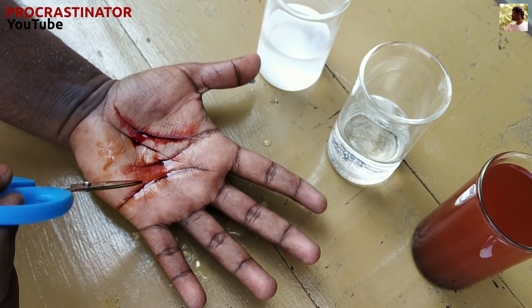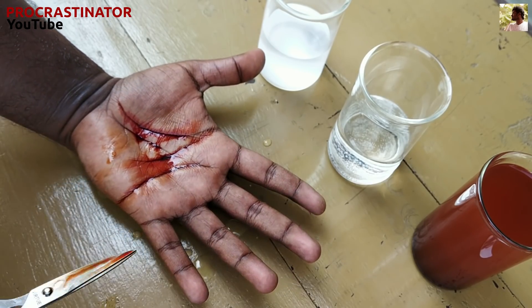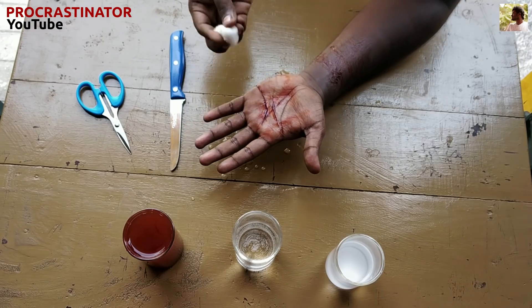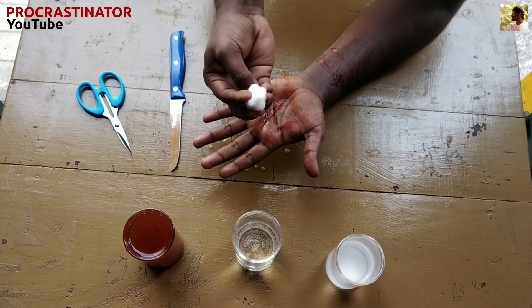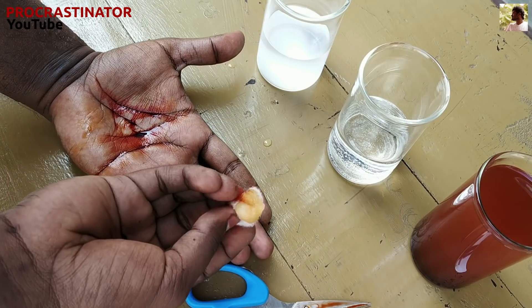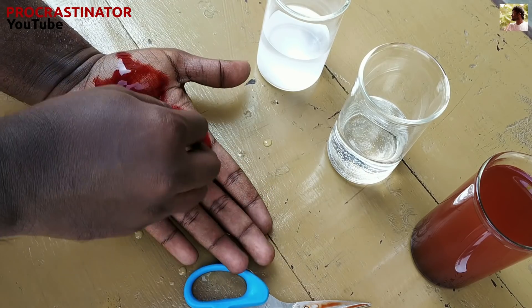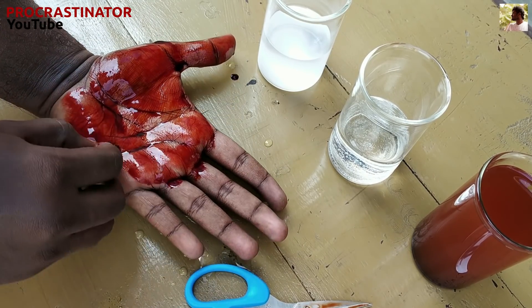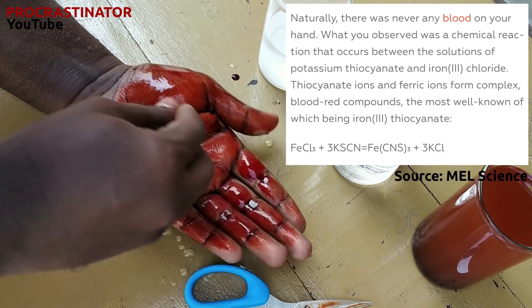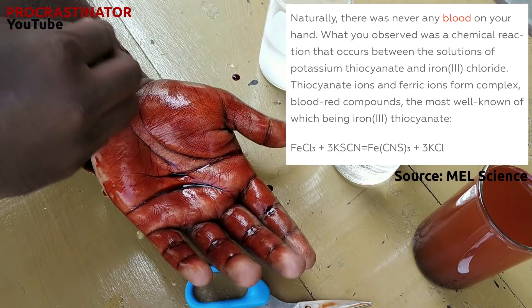As you can see, this is a chemical reaction. We apply the potassium thiocyanate solution, and at the top we have iron 3 chloride. When we touch the two chemicals together, it will form iron 3 thiocyanate. This is the red color.